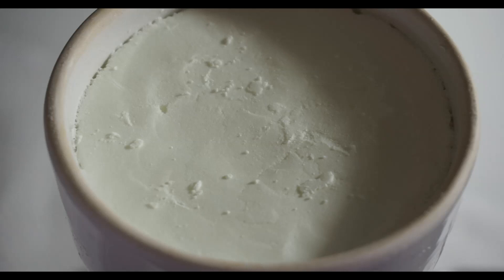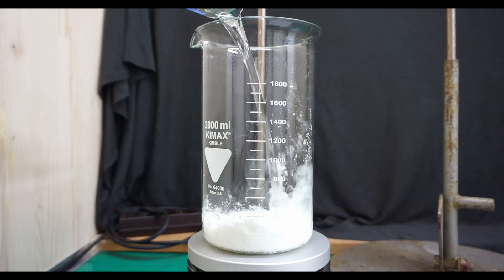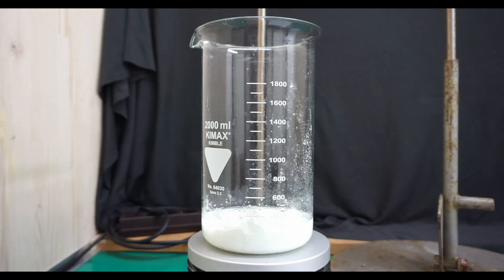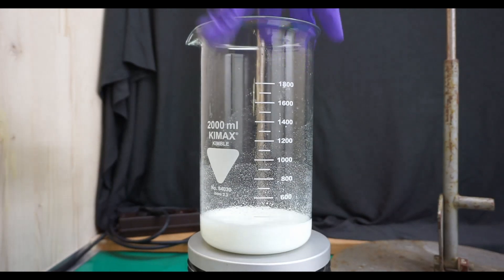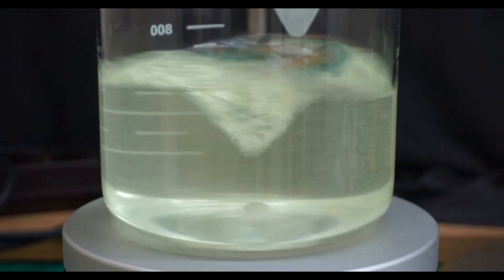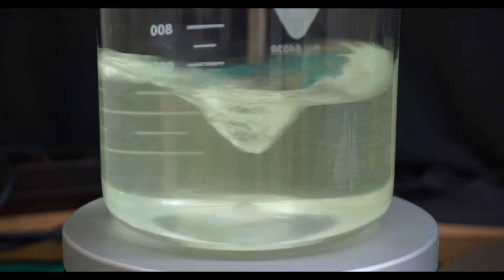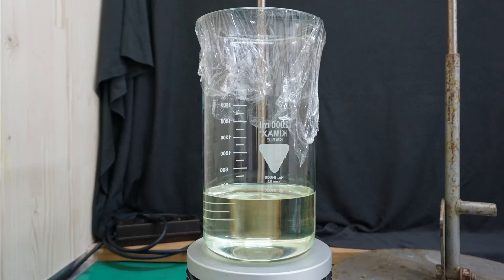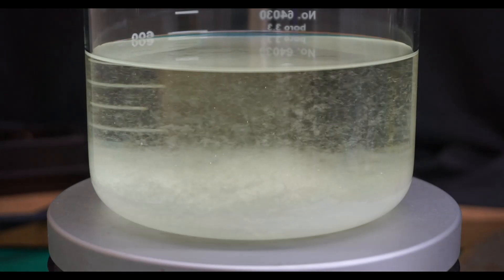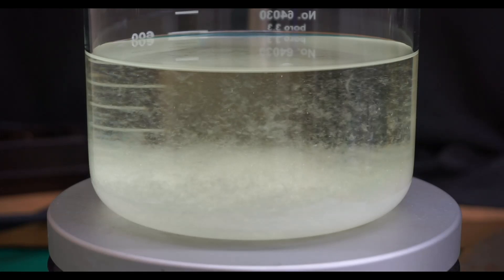The product looked really nice, but I decided to do a second crystallization. The damp product after the first crystallization had a mass of 104 grams. I transferred the damp product back to the 2-liter beaker and again, while stirring and heating, dissolved it in fresh 96% ethanol. This time I needed 520 ml of 96% ethanol to get a clear solution. And as you can see, this time the solution isn't yellow but almost colorless. I also managed to capture the majority of the second crystallization on video — the crystallization you are watching isn't sped up, this is real-time footage.